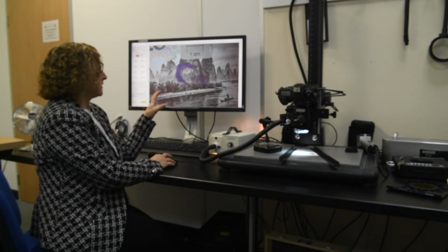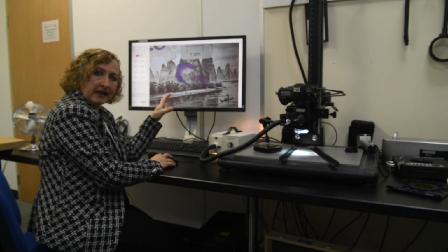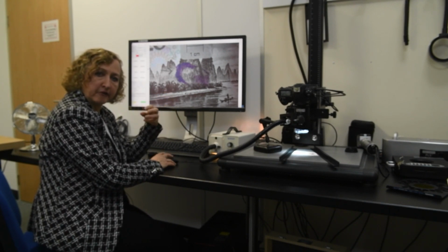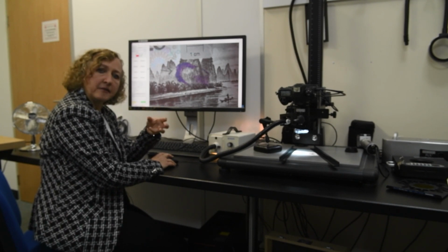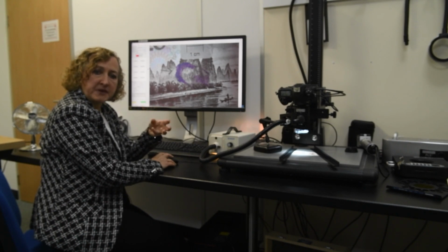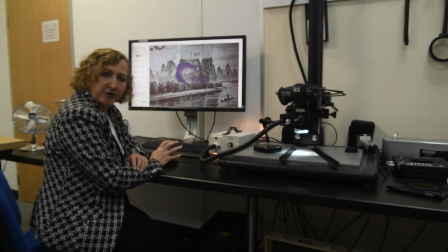So the image we're going to look at here is ninhydrin on currency. And as with a lot of currency, we have multiple layers of background pattern. So we're going to use this to show you using color channel modeling to remove the color information. And then we're using the Fourier transform to remove regular repeating background patterns that you cannot see at the moment.